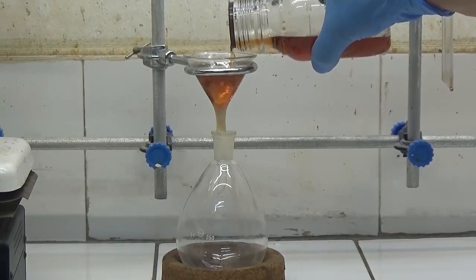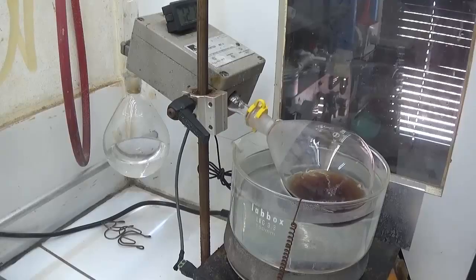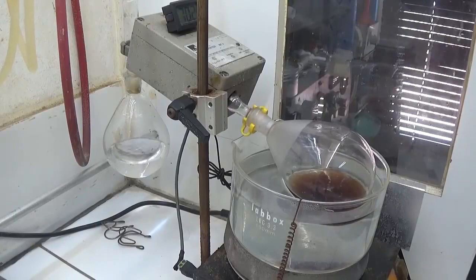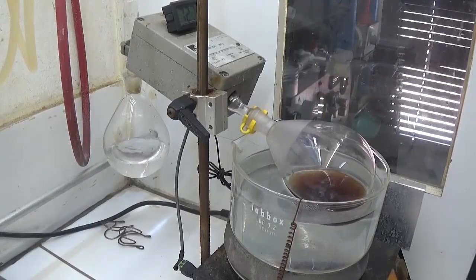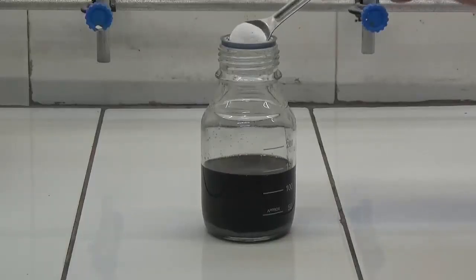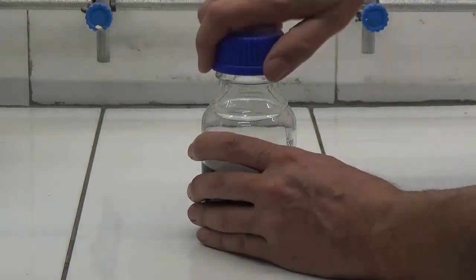Filter the organic extract and evaporate the dichloromethane. The product produced is diluted with a little dichloromethane and dried on magnesium sulfate.